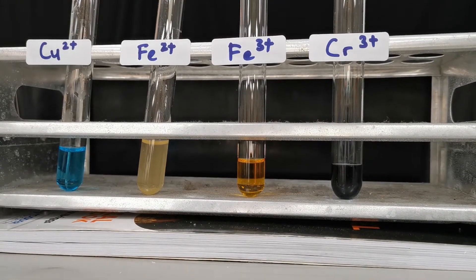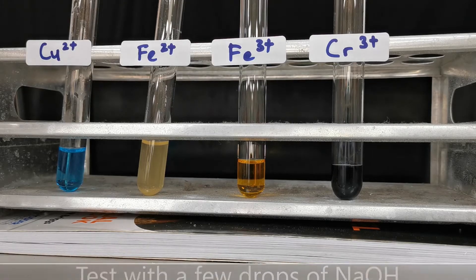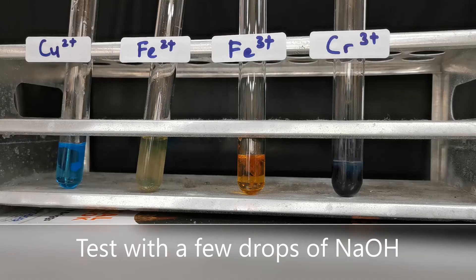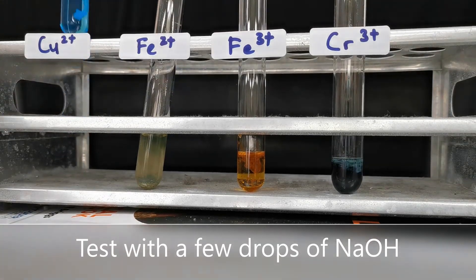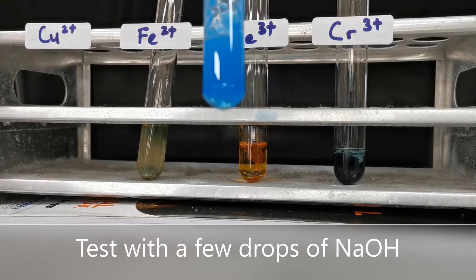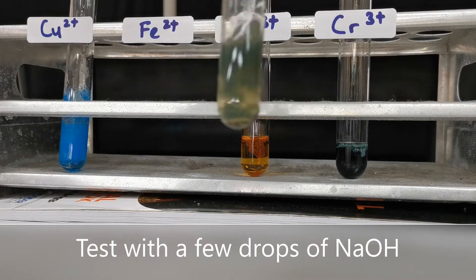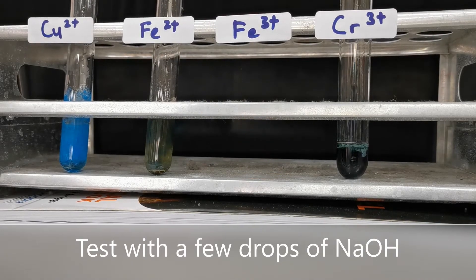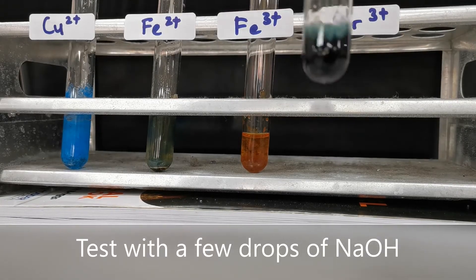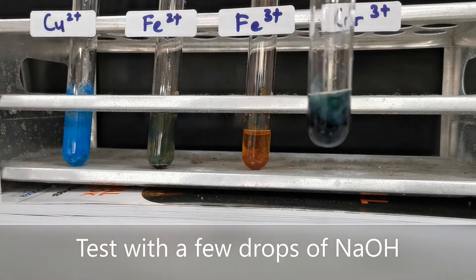Now we're going to test for copper(II), iron(II), iron(III), and chromium(III) ions. We are still going to use sodium hydroxide. Adding a few drops of sodium hydroxide: with copper(II) there is a blue precipitate formed, with iron(II) there is a green precipitate formed, with iron(III) there is a reddish-brown precipitate formed, and with chromium(III) there is also a green precipitate formed.